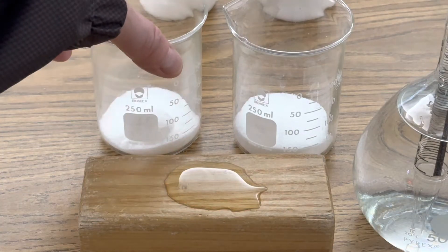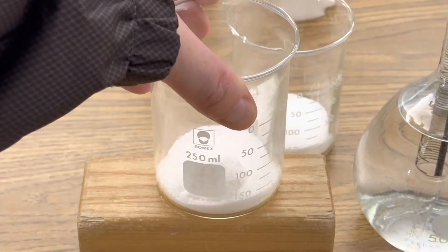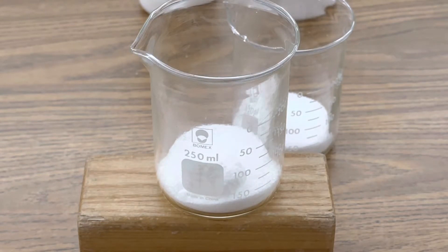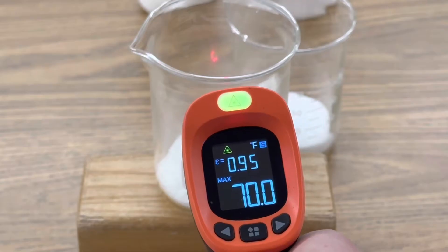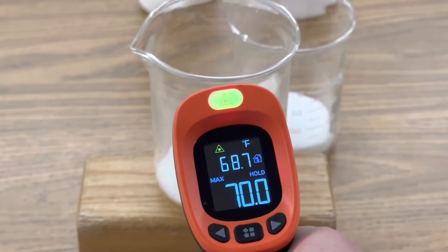You're going to carefully take one of the beakers and place it right on that water — some of it will displace onto the table, and that's okay. Then you're going to pour the other beaker in and start mixing it. But before we pour, let's get a base temperature: it's about room temperature, 70 degrees Fahrenheit, and it's going to get a lot colder during this reaction.